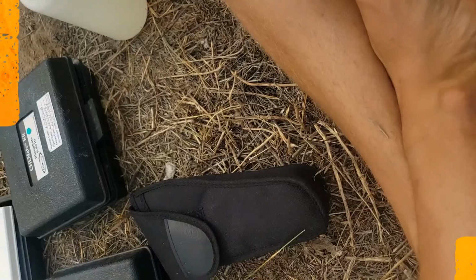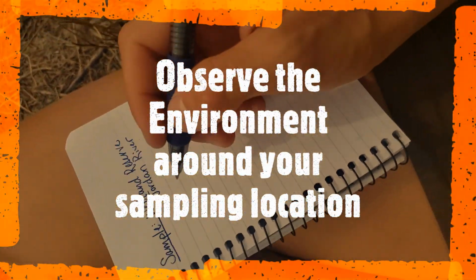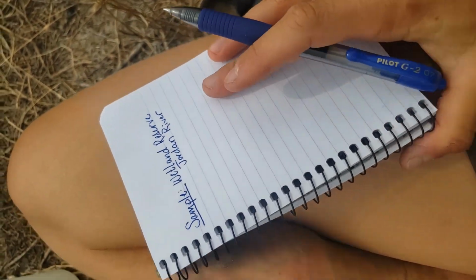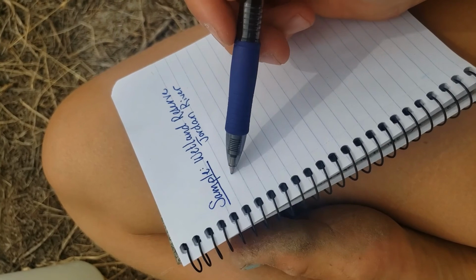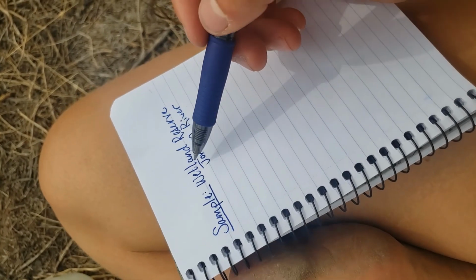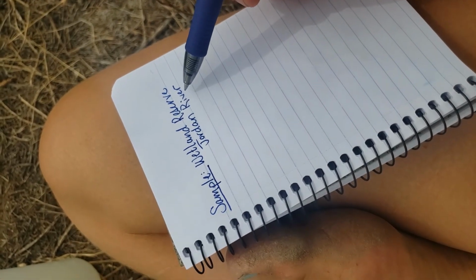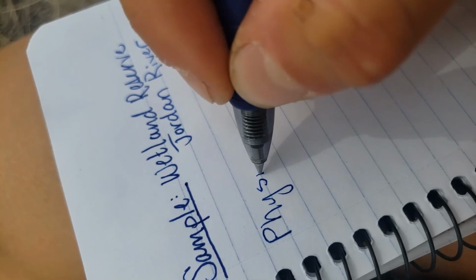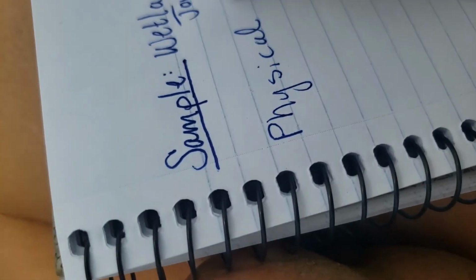All right, and our most important piece of equipment is our notebook. So we're going to start by taking notes, and I'll show you how to do this. You want to make sure you know where your sample's coming from. So I'm going to label the sample Wetland Reserve on the Jordan River. And then I want to take some data on the actual physical environment.